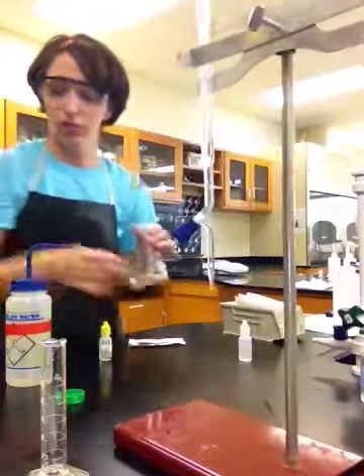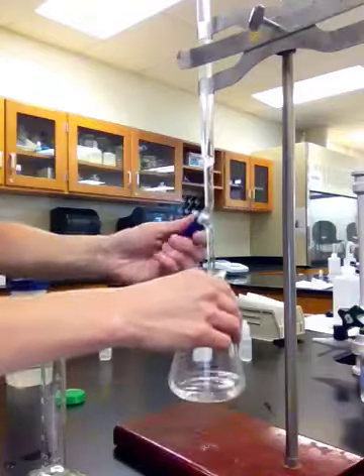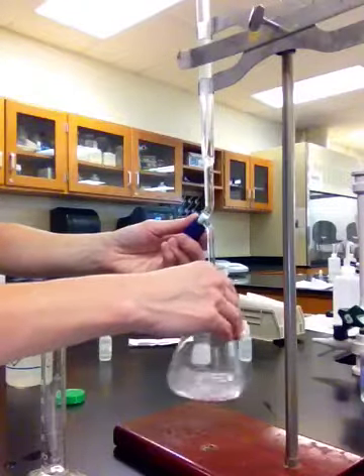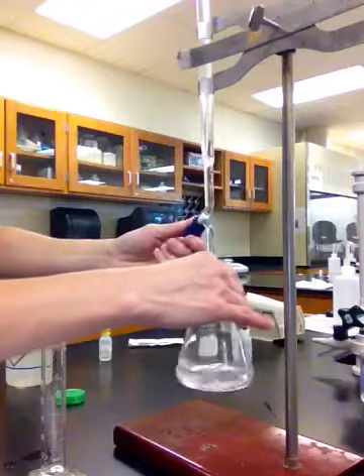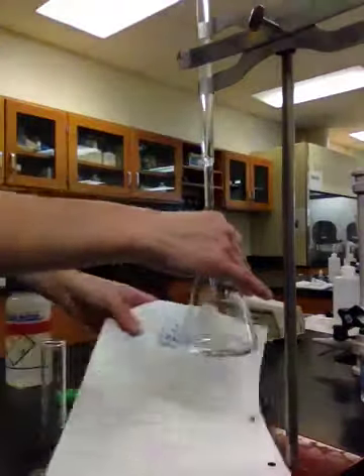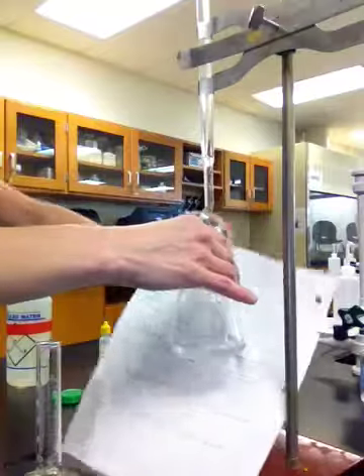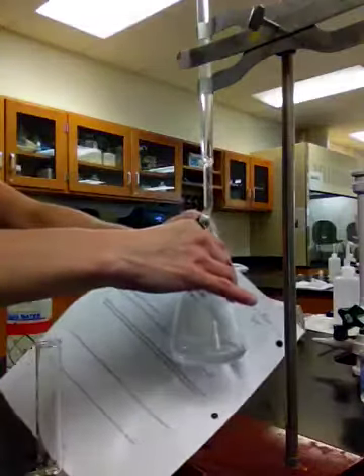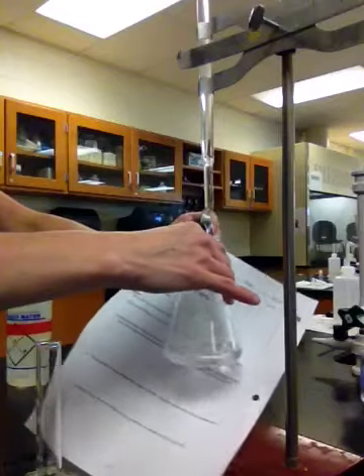I'm going to get a little closer so you guys can see, okay? Basically, I'm going to add that NaOH. Now, if you look really closely, can you see a little bit of that pink color? Might help if I put a white background up against it somehow. That doesn't really help, does it? I need another hand. Try that. See? Now you guys can see that pink, alright? But you know what?